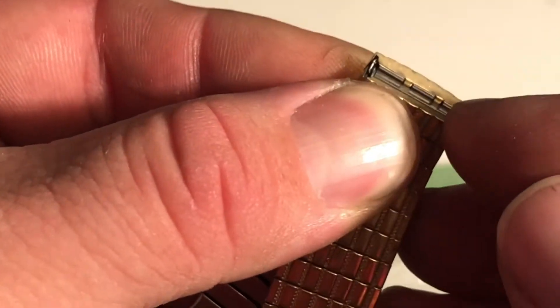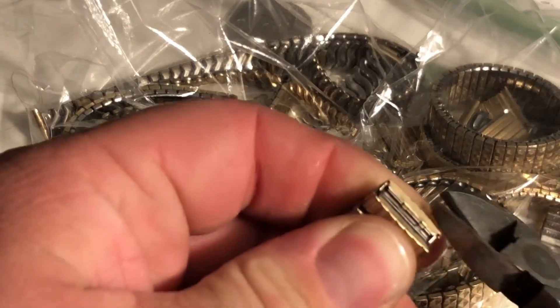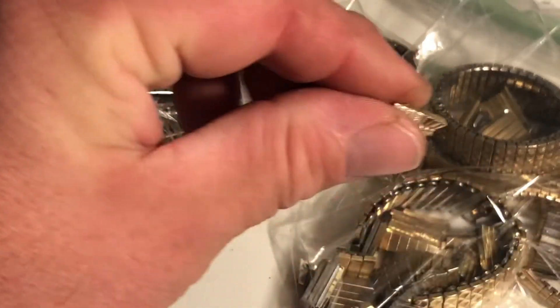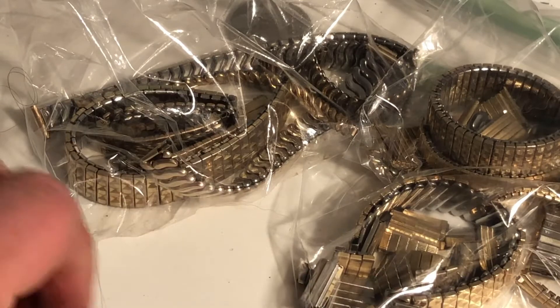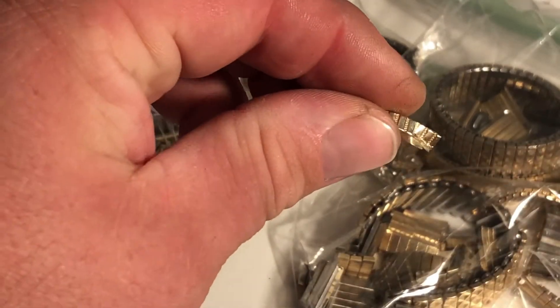If you see right there where those two little tabs are, you got a little pair of cutters. You go in just like this and you pry them off — and these are the caps. So out of 400 grams in watch bands, we're going to see how much gold caps we actually have. The watch bands are mainly stainless steel, so these are pretty much worthless. The caps are what actually have the gold-filled material on top.